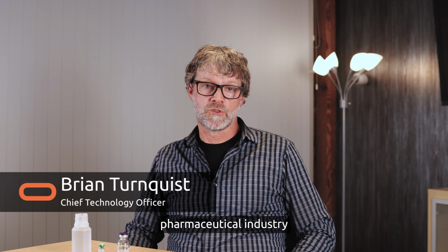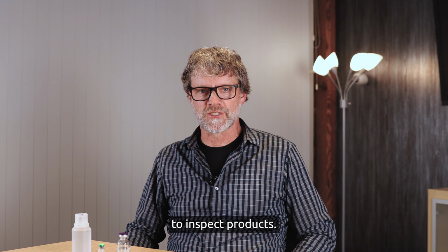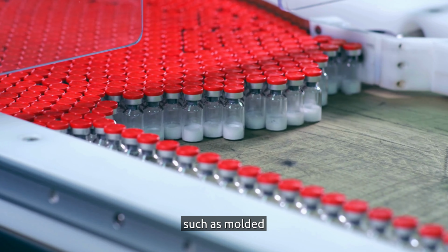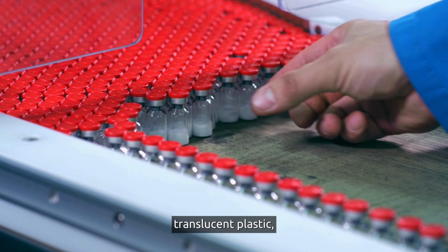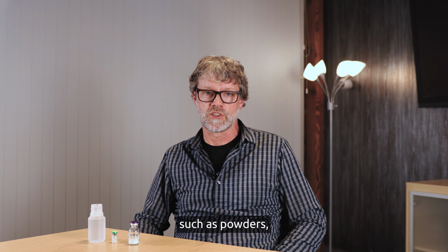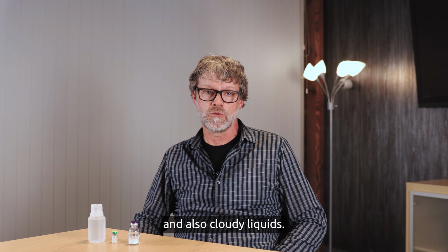There's a gap in the pharmaceutical industry for visual inspection of difficult to inspect products. These products have challenging primary containers such as molded glass, amber glass, and translucent plastic. And they also contain challenging pharmaceutical products such as powders, freeze-dried products, and also cloudy liquids.